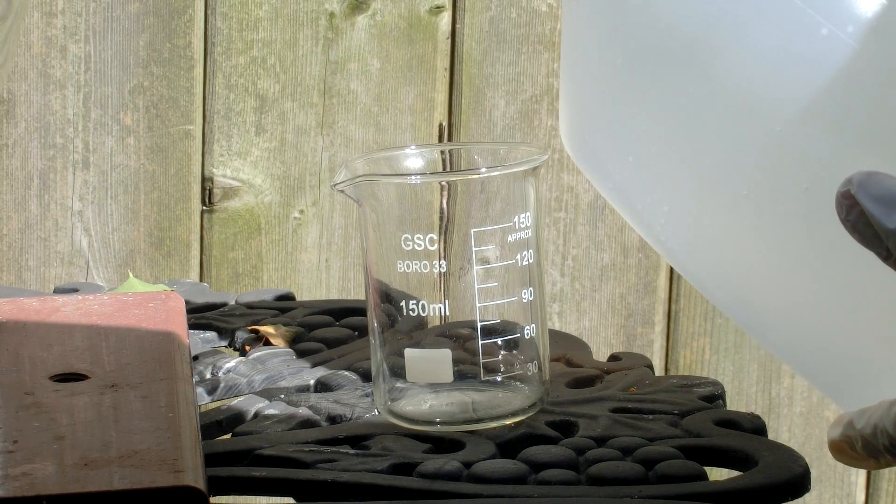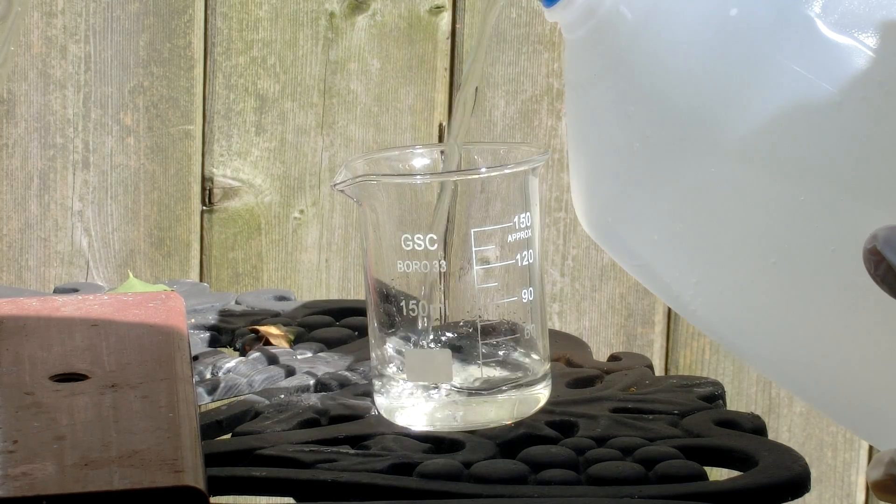Welcome to the Chemikid. In this video, we will make copper-2-chloride.